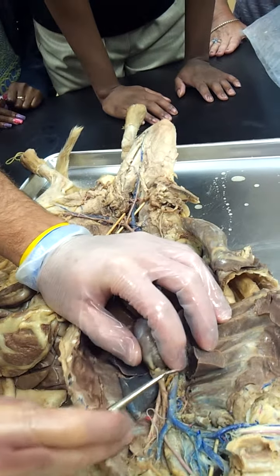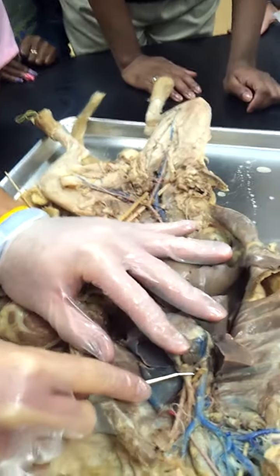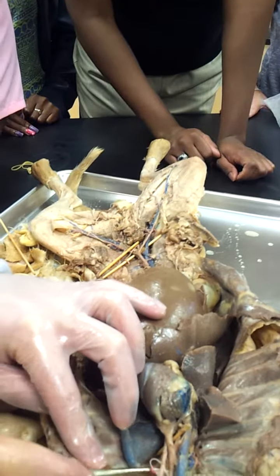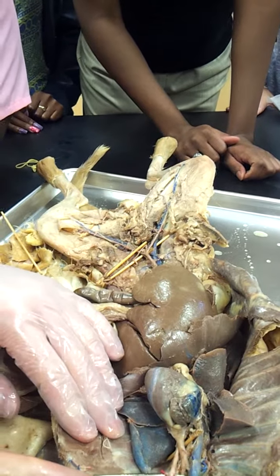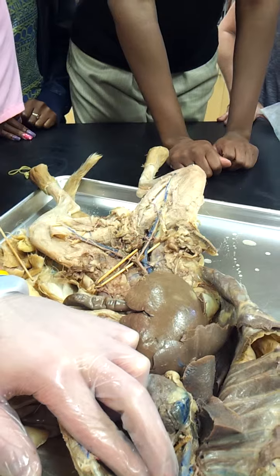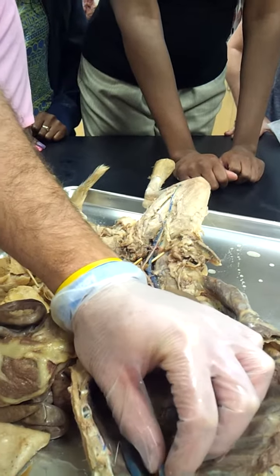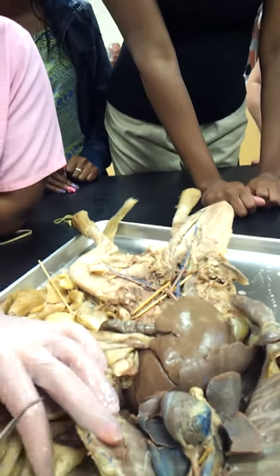They connect at the aorta, and then they branch off. We've got this one branch that goes straight to the arm, that's your subclavian, and then we have a branch that's going to go up to the head, which would be common carotid. And we have a left and a right. Same setup in the human there with left and right. That's about it for this section.